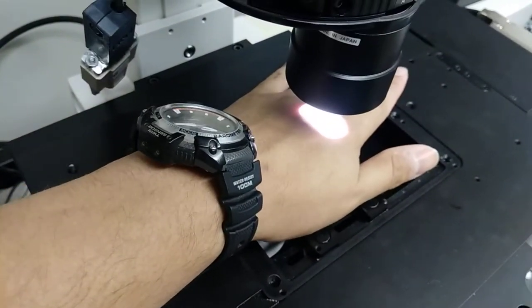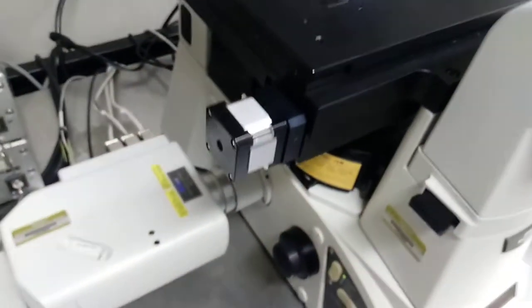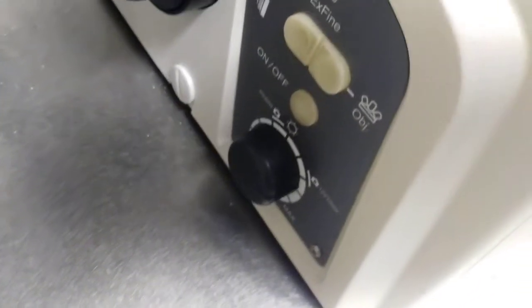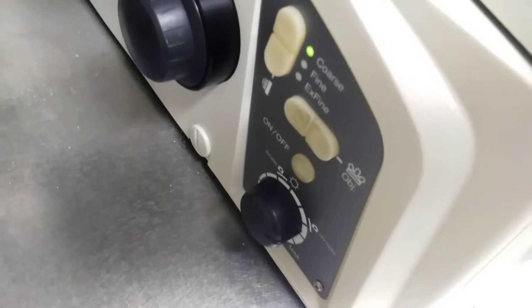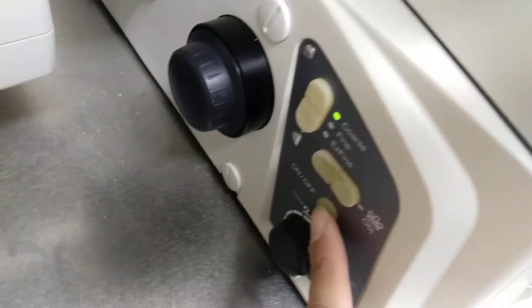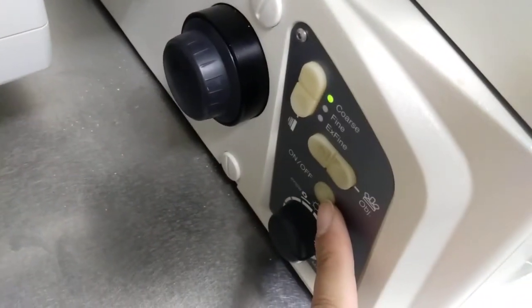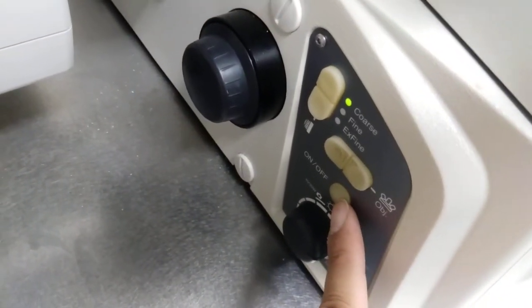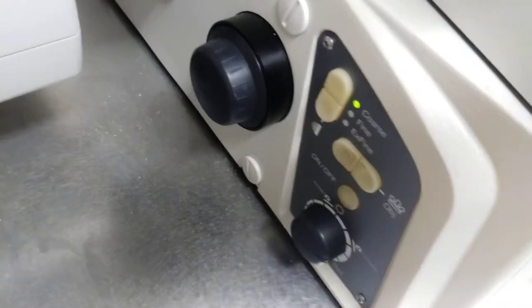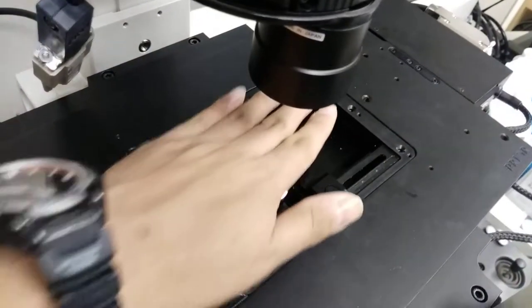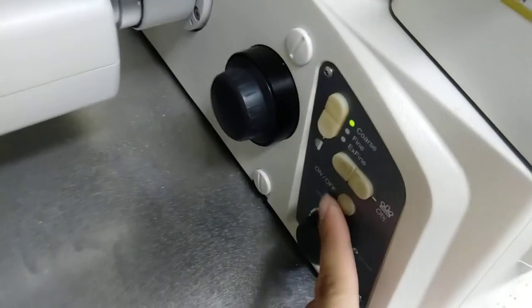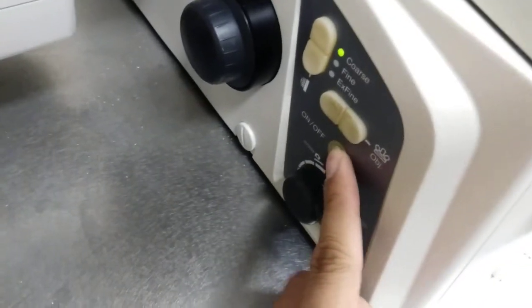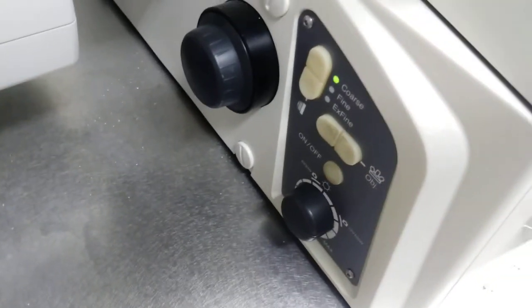If you don't see anything, what you can do is to the left of the microscope, just double check that it's on. You can press the on and off button here for the lamp. You can see it turned off. So it was on, turned it off, now I'm going to turn back on.